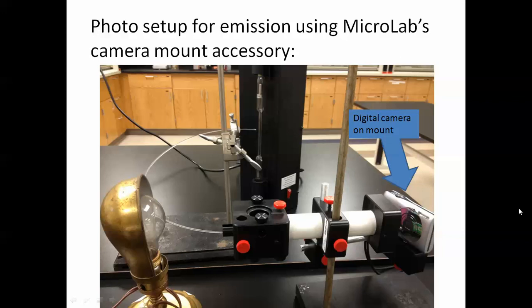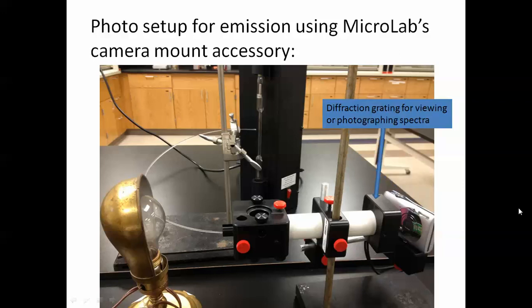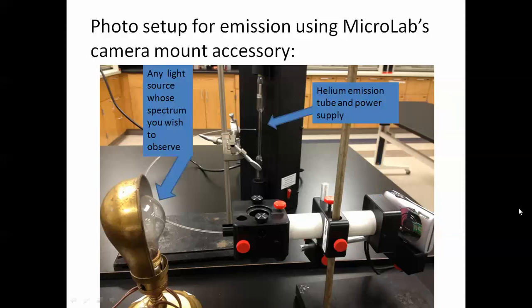So the digital camera in this case is on the Microlab accessory camera mount. You could also use a tripod, of course. This is a Canon point and shoot 12 megapixel camera. You don't need anything that fancy, but it helps to have something that you can actually mount on a tripod or something like that. And I also have it set up for a timed shutter, so I have a 2-second delay on the shutter, so I'm not jerking the camera around while I'm taking the picture. We have a diffraction grating for viewing or photographing the spectra on the back of the spectrometer.